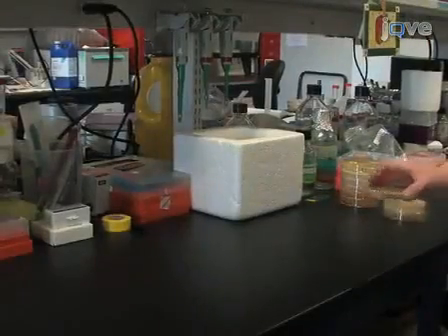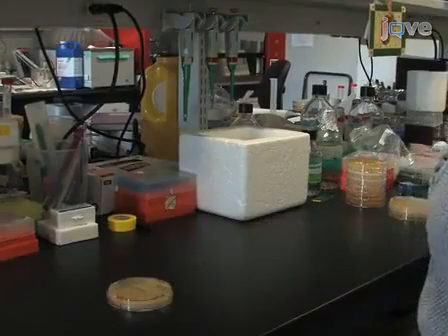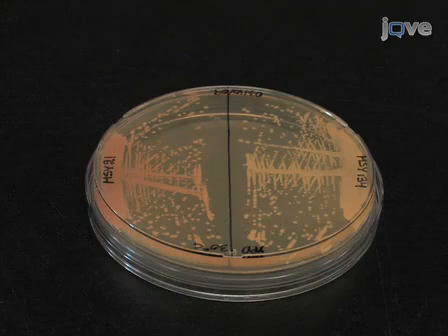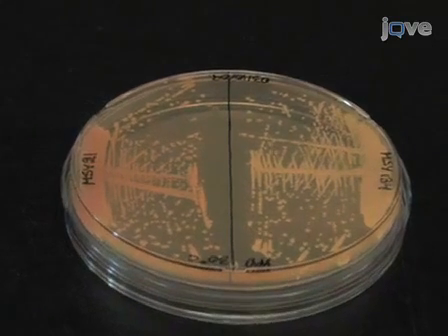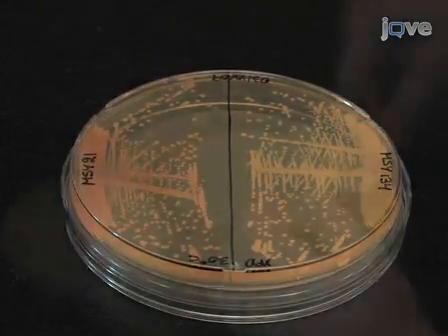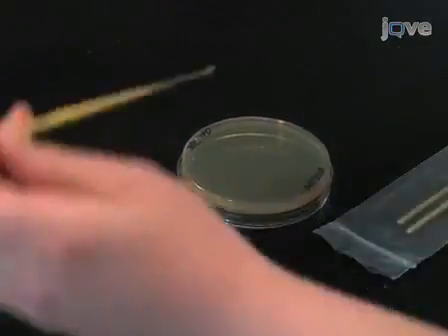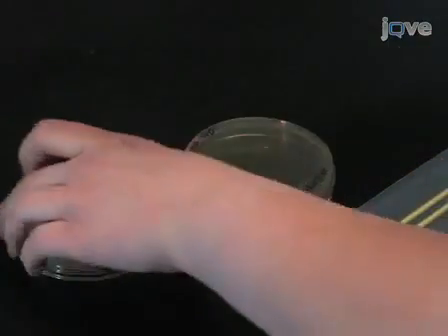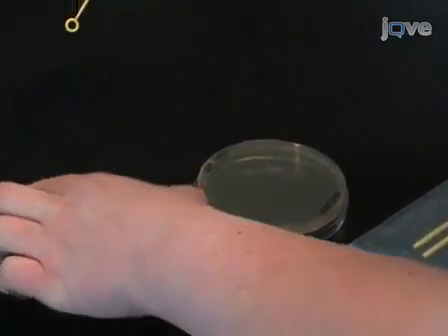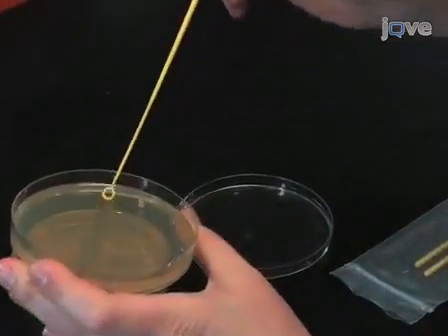To construct a diploid strain, two haploid strains of opposite mating types are mated. The haploid strains are first struck out on appropriate media — YPD in our case — to produce single colonies. Using a sterile inoculation loop, pick a small portion of a colony from one of the two haploid strains. On a new YPD plate, streak the loop once in a straight line across the plate.